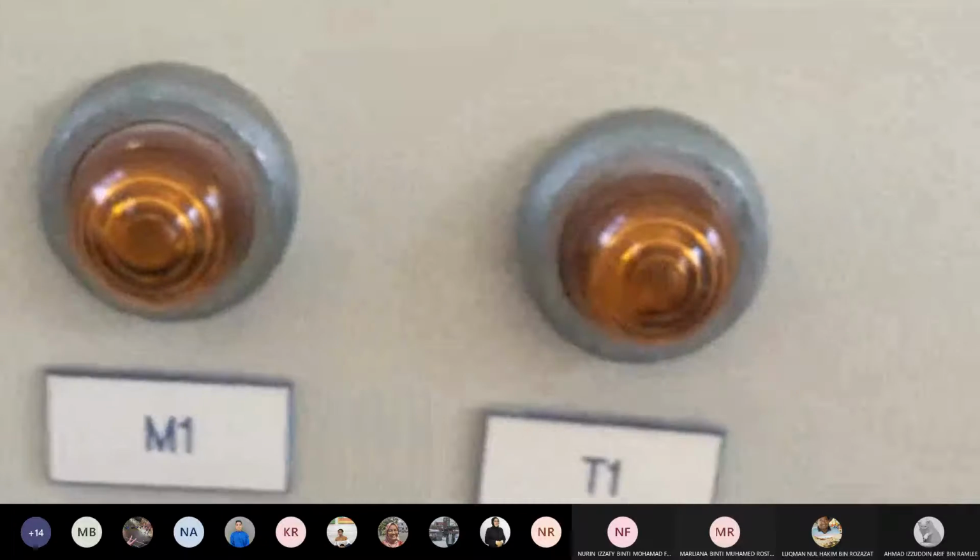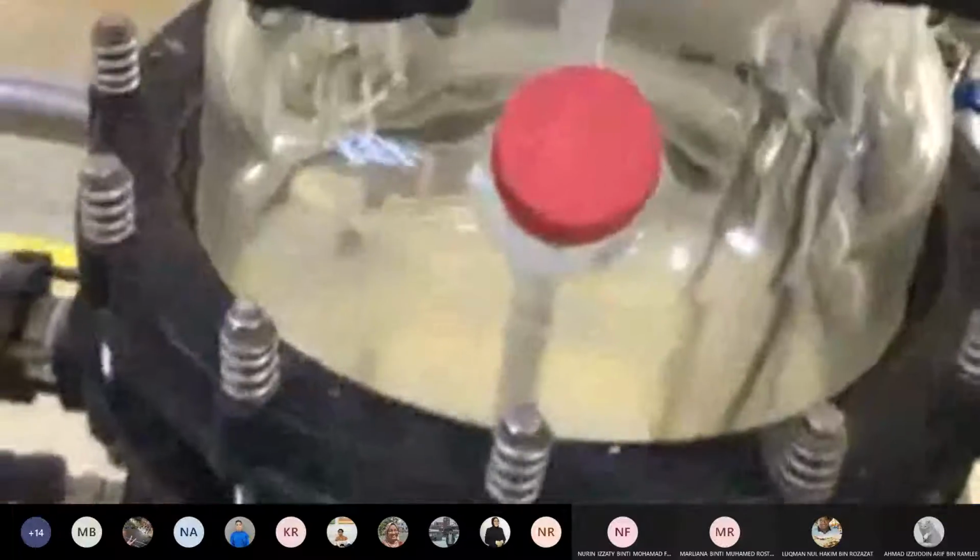So what happens when you switch on this one? Our water bath will function, and then of course it will start to heat up the water. Then it will flow into the heating jacket outside of the vessel. So later in experiment 1B you have 2 temperatures, which means one experiment at a certain temperature, I cannot remember what temperature I gave you, let's say at 40. So at 40 we run the first experiment.